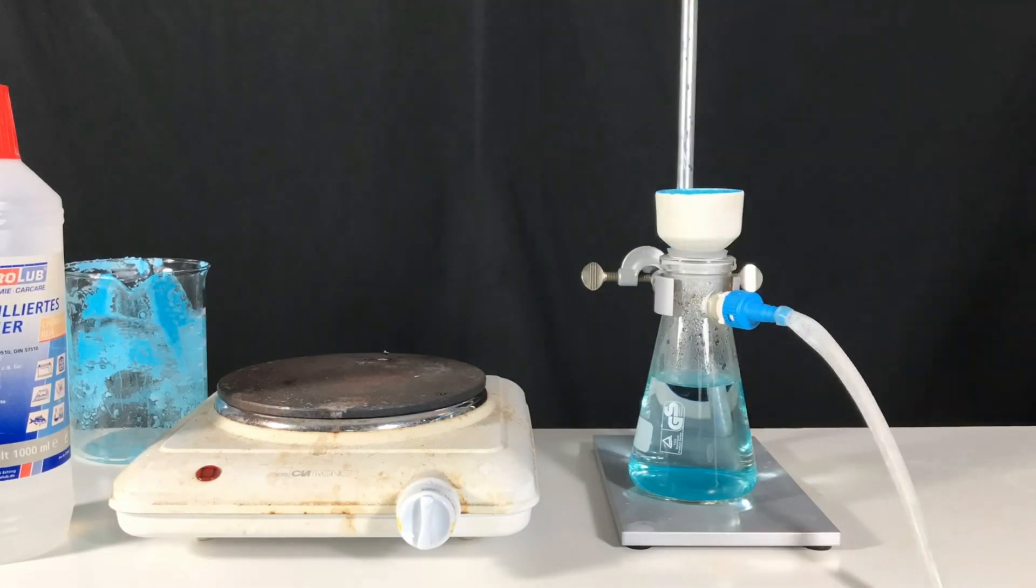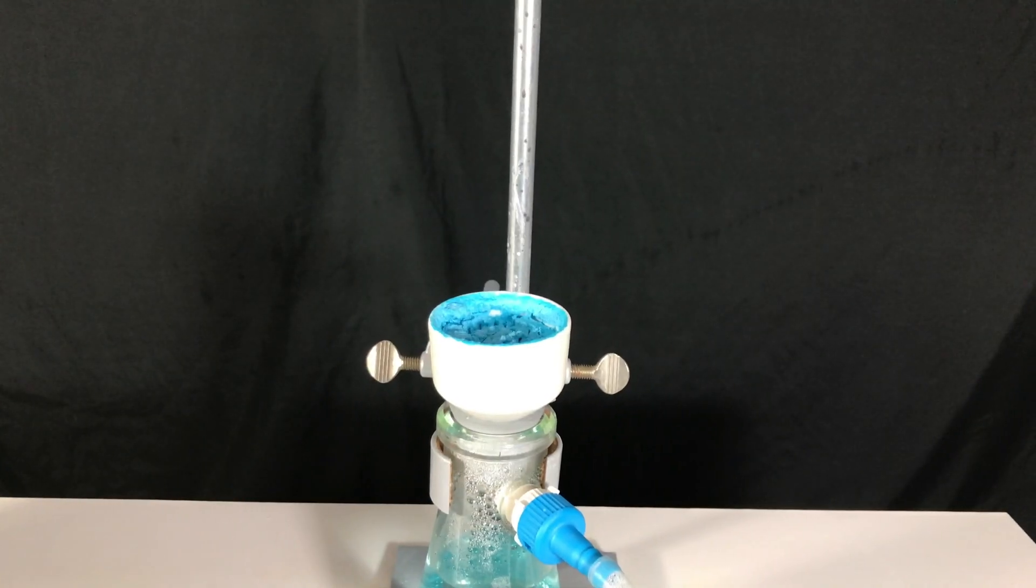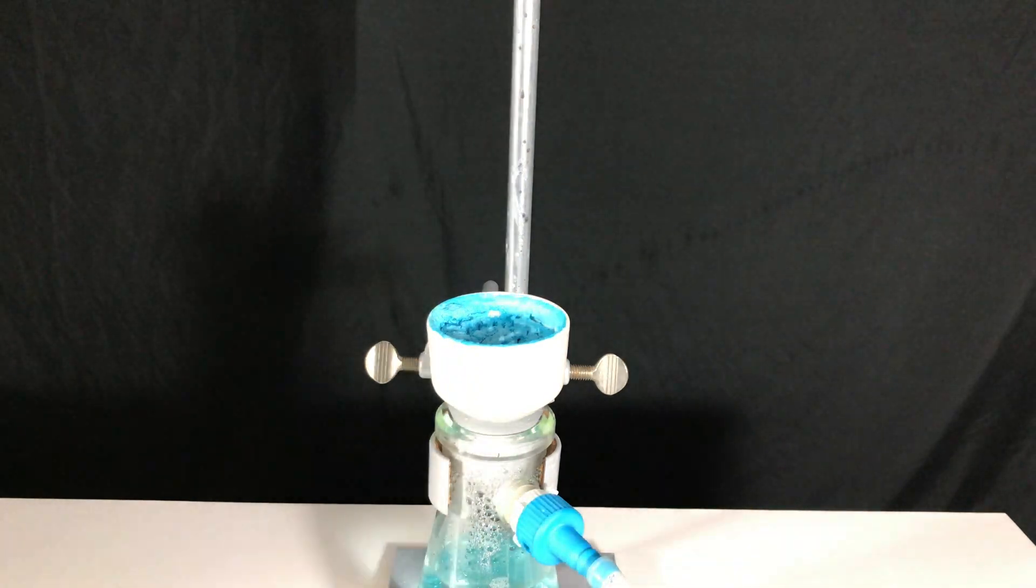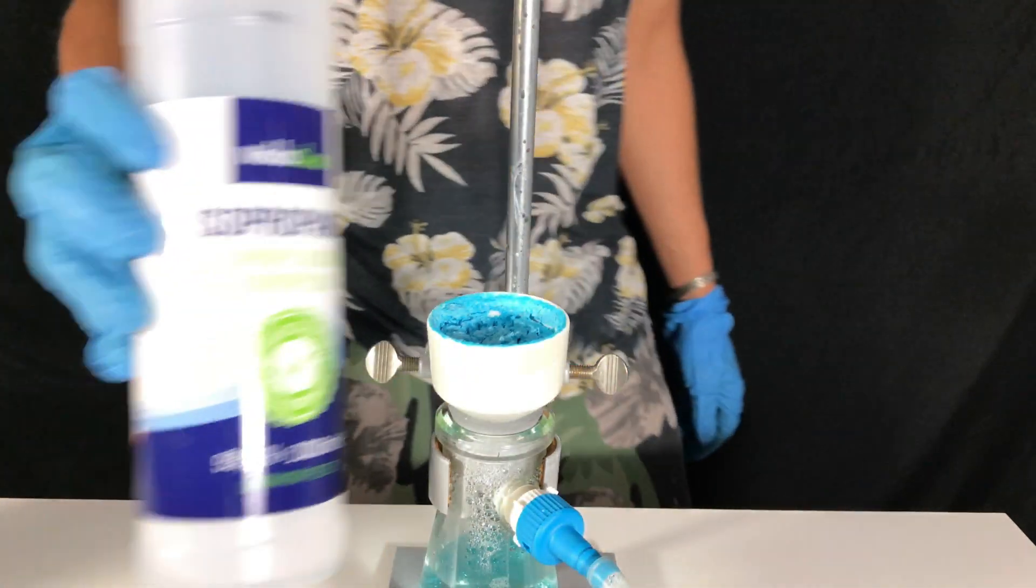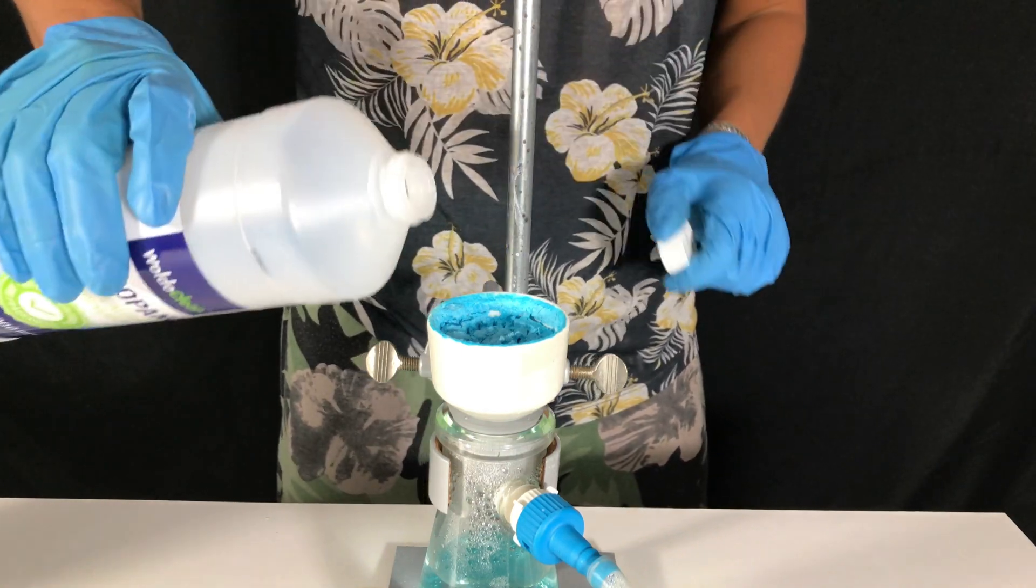The product was washed twice using distilled water. Because I am lazy and didn't want to wait for 30 minutes or whatever for our product to dry, I washed twice using 99% isopropanol.